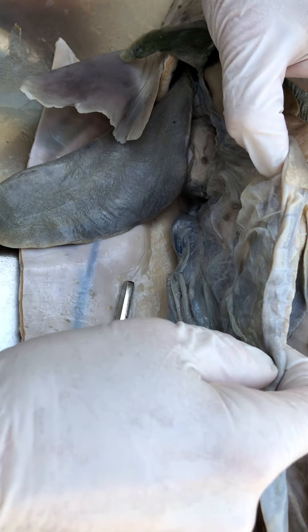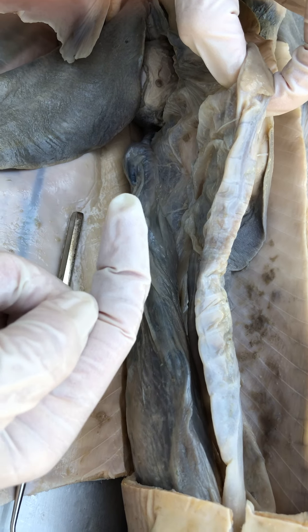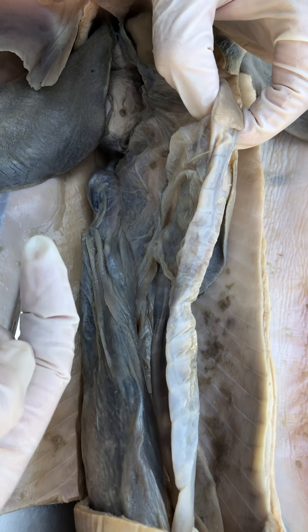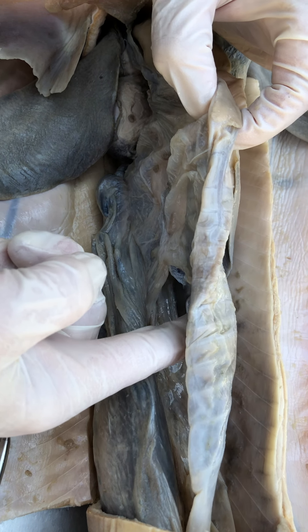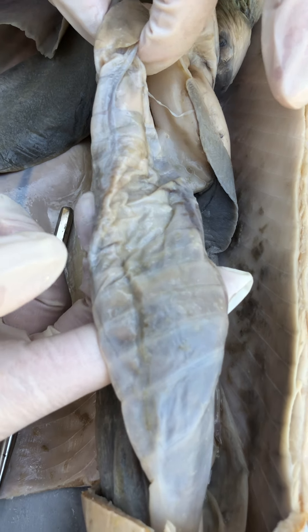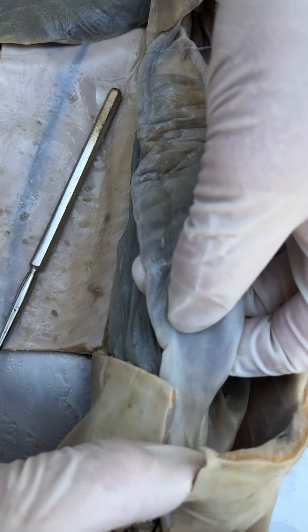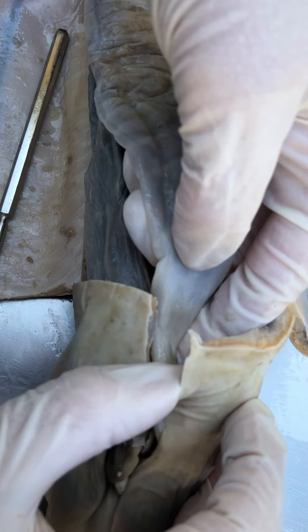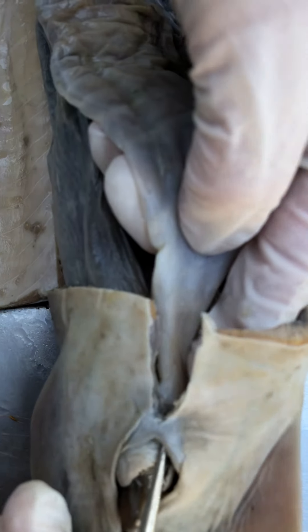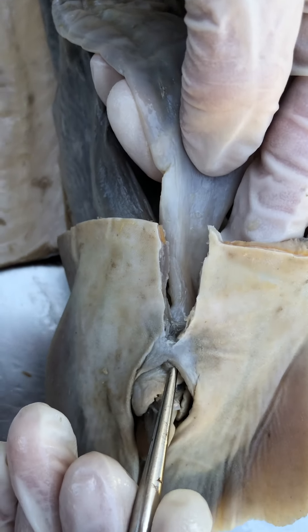Following the duodenum, we have a larger banded structure — that's because inside it has a spiral valve. This is called the valvular intestine or the spiral intestine. Continuing downward, we have the colon and the rectum entering into the common cloaca. And that is it — mouth to anus.